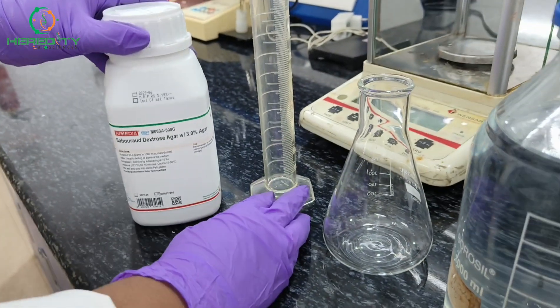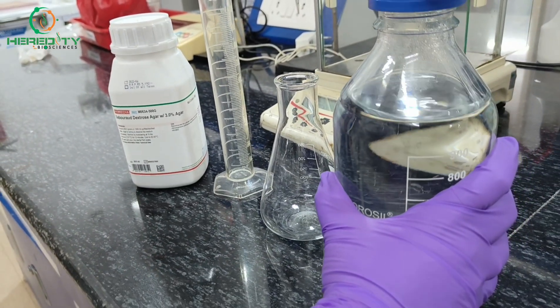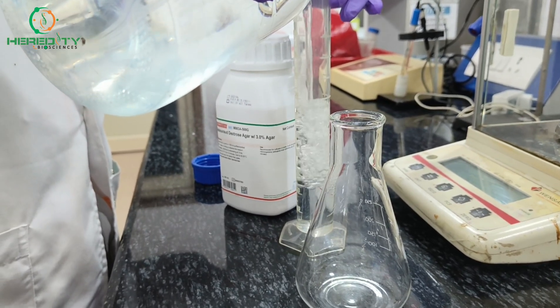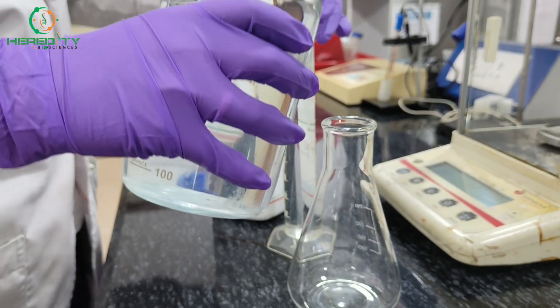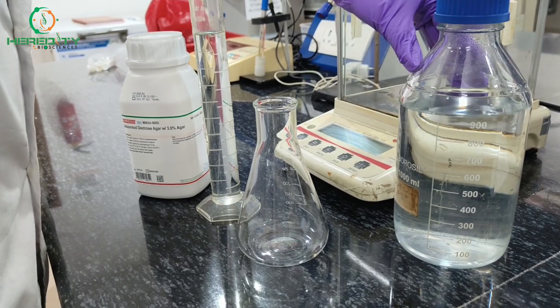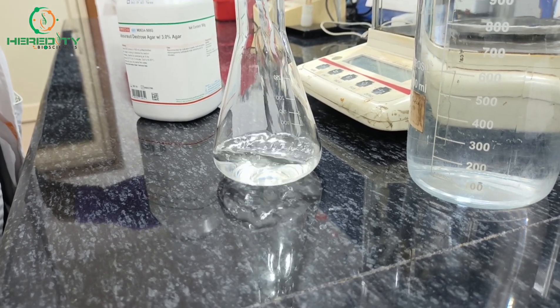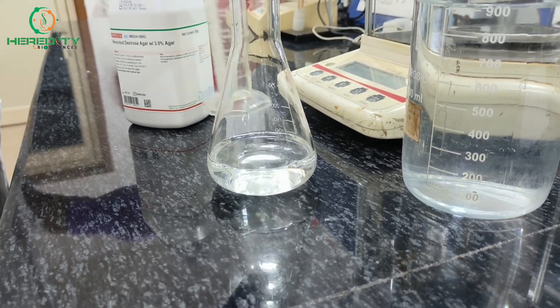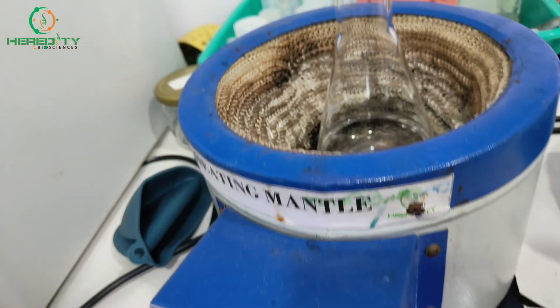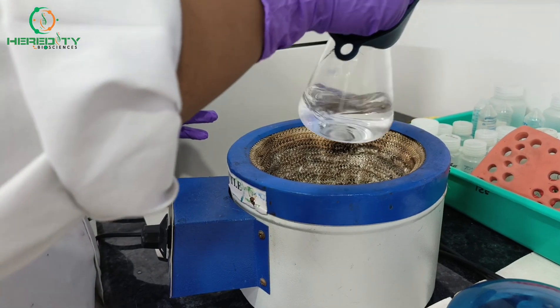So we will prepare for 100 ml. First, we will measure 100 ml of distilled water and transfer it to the conical flask. After that, we will lukewarm the water. Now our water is a little warm.